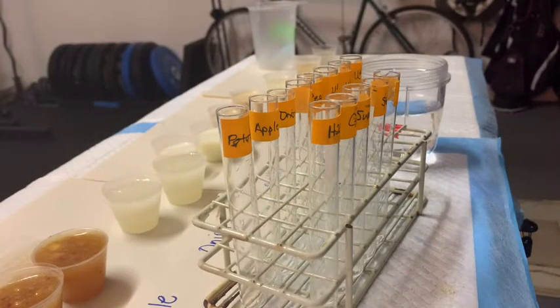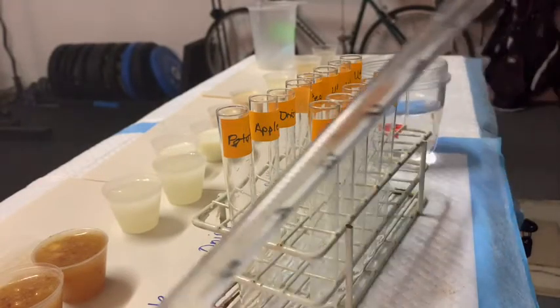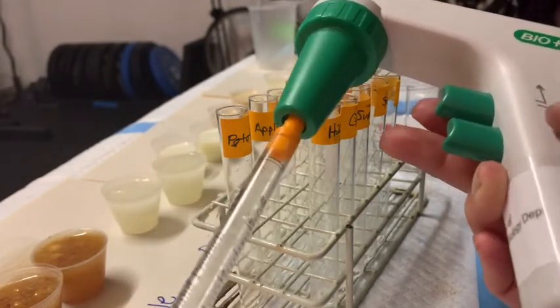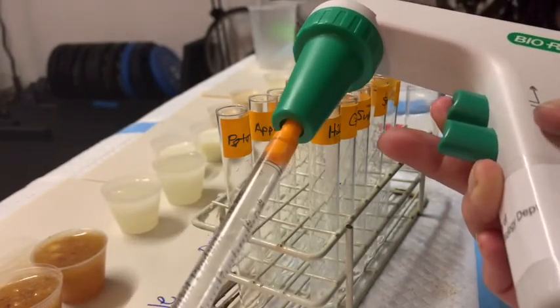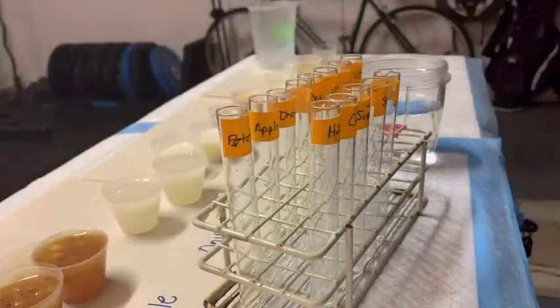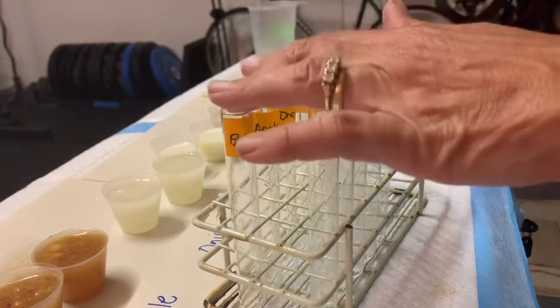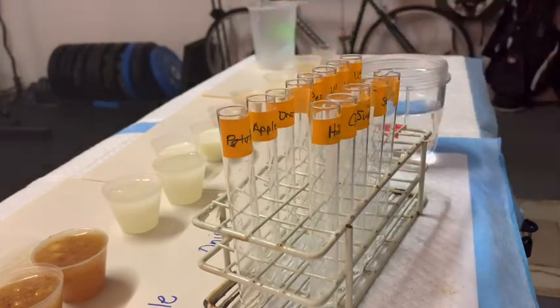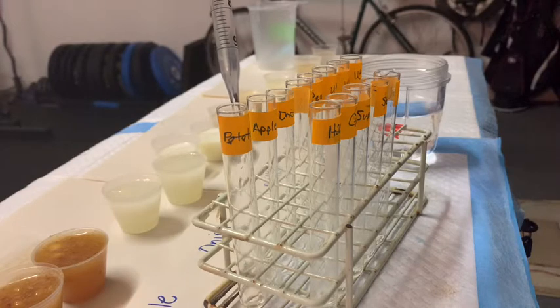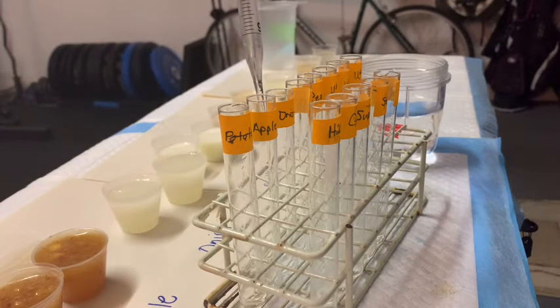To pipette the rest of them, I'm going to use what's called a pipette aid. This is a battery-driven pipette aid. If you press the top button, it will suck up liquid; if you press the bottom button, it will aspirate it out. For these eight tubes, I'm going to suck up eight mils of water and then simply use the pipette gun to dispense one mil into each one.